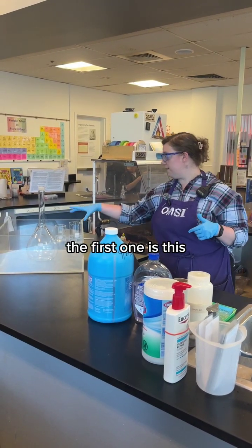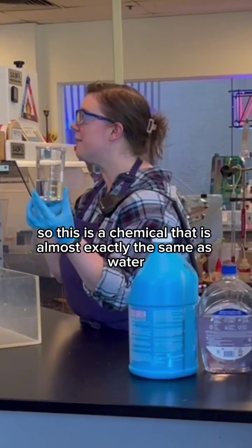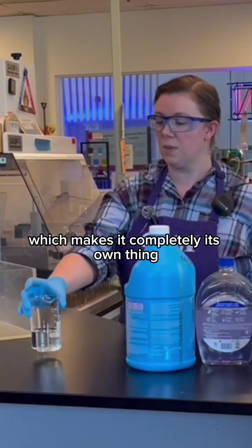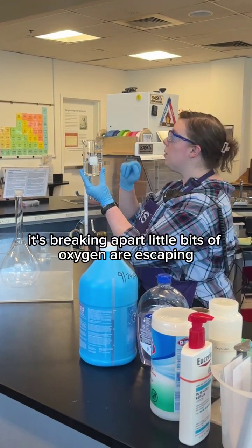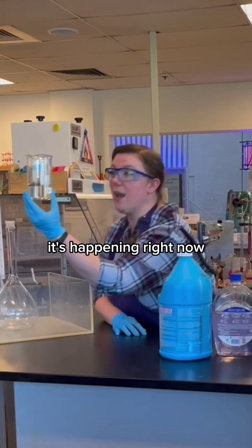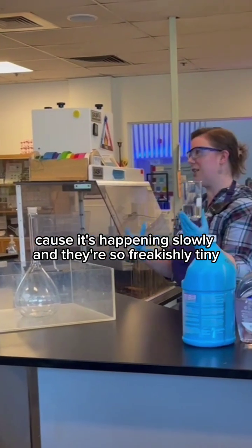The first one is this. So this is a chemical that is almost exactly the same as water, but a little bit different, which makes it completely its own thing. So this hydrogen peroxide is actually kind of unstable. It's breaking apart. Little bits of oxygen are escaping. Boing, boing, pew. It's happening right now. But it doesn't look like much because it's happening slowly and they're so freakishly tiny.